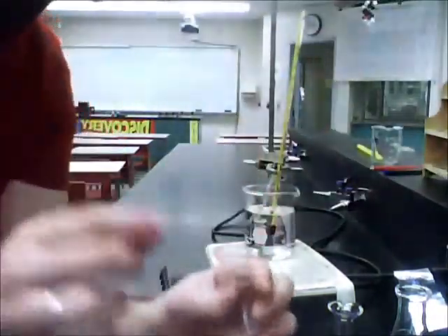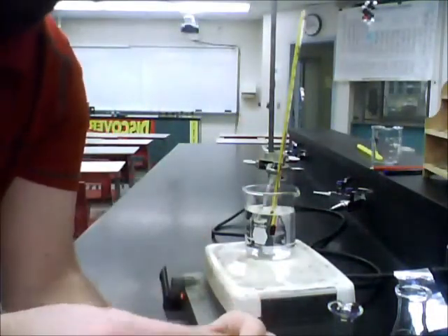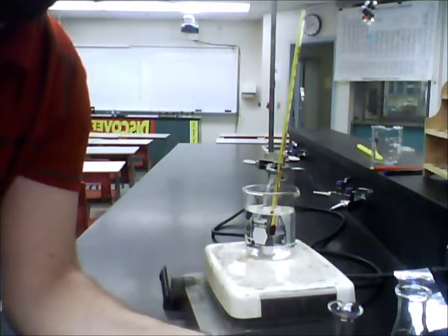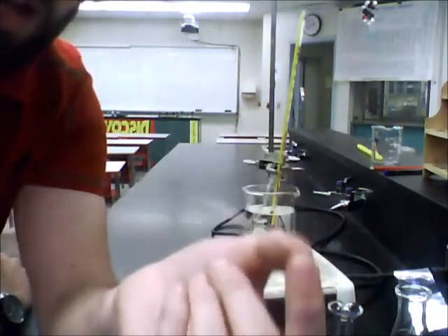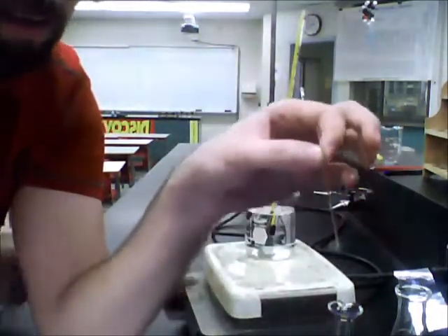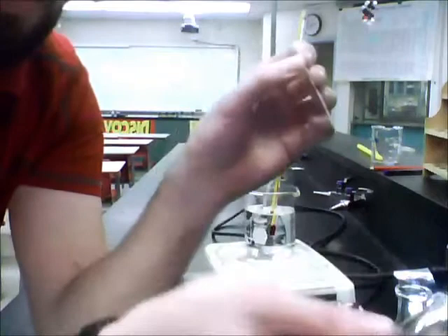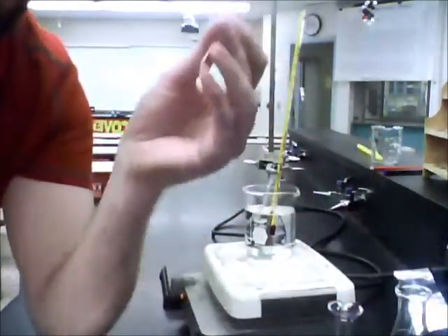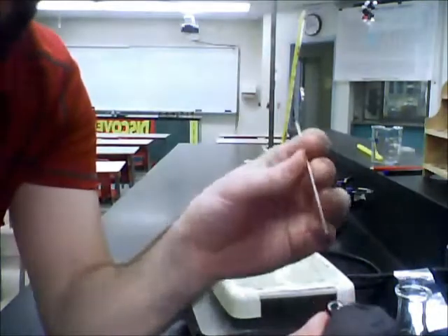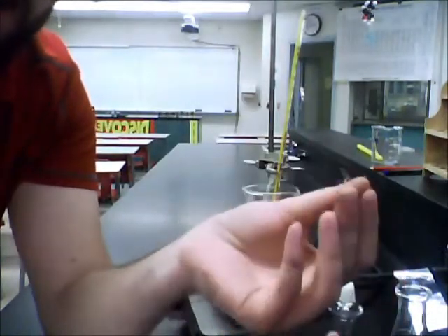Now with these ones in particular, certain classrooms will use capillary tubes that are plastic, some will use glass. For this particular experiment, we're using something that's made of glass. When you're dropping it into the test tube, you want to make sure that you're not dropping too forcefully or bending it or even stabbing it and twisting, because if you do that it's going to start breaking and that's no good.